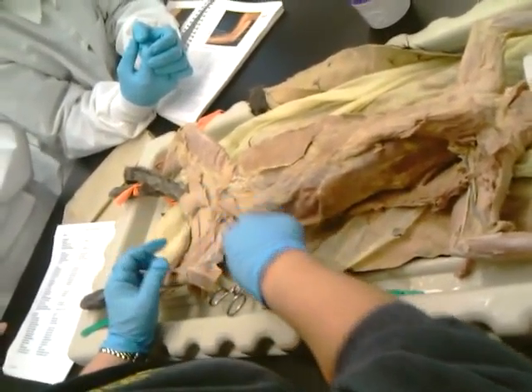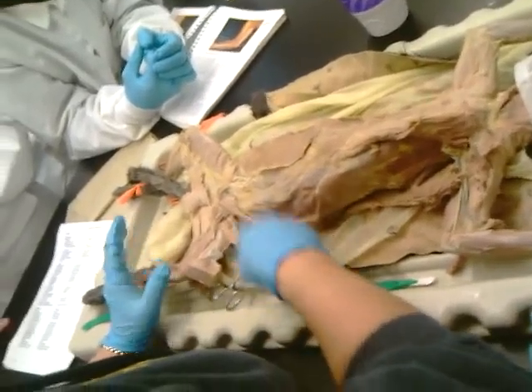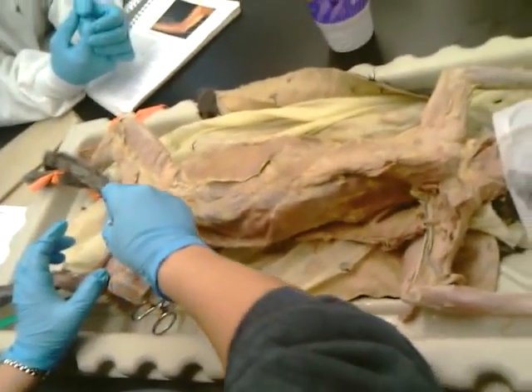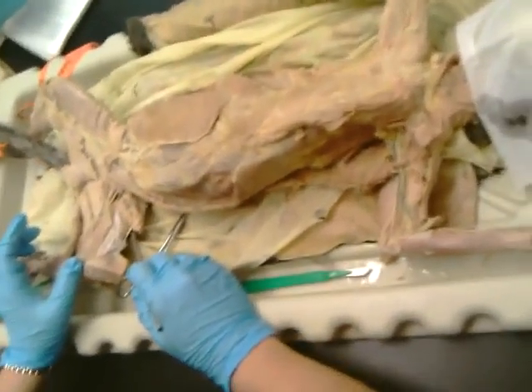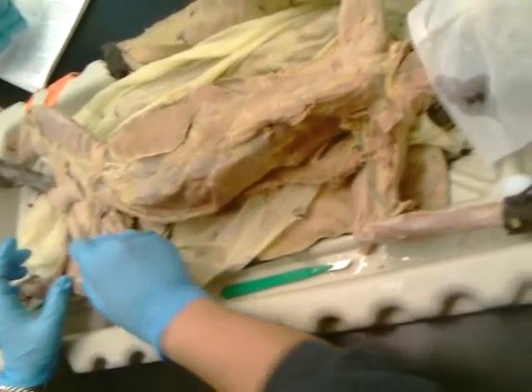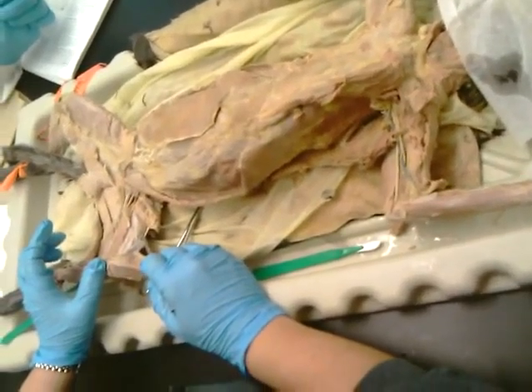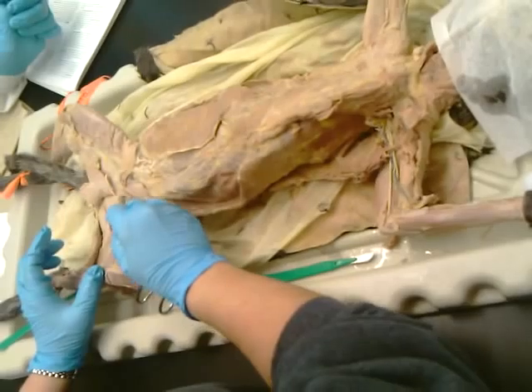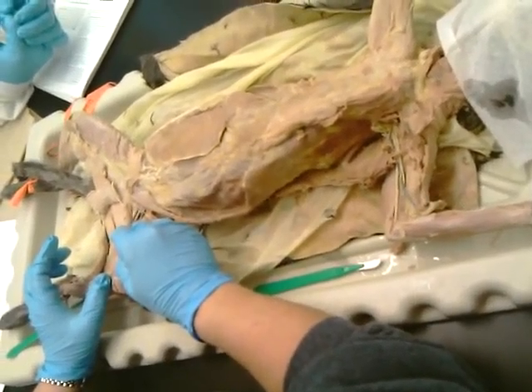Okay. In the human, a little different, so we have to just remember by location on that. What would this be? This is only in the cat. You're on the right track. I heard it. Adductor femoris. Good. Adductor femoris. And then this one up here, that would be the adductor longus.